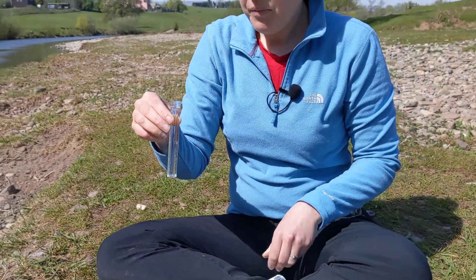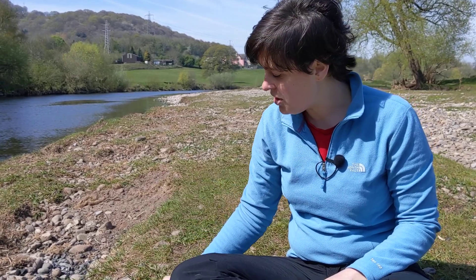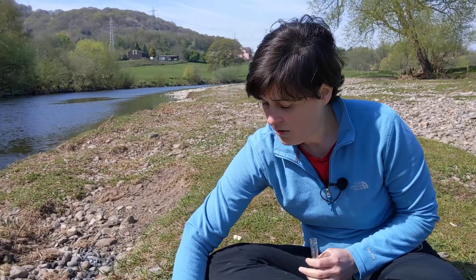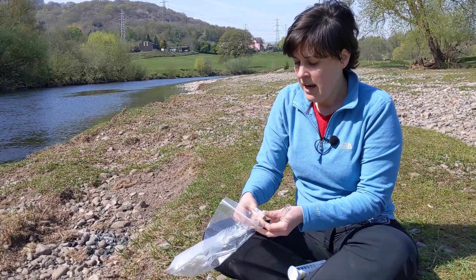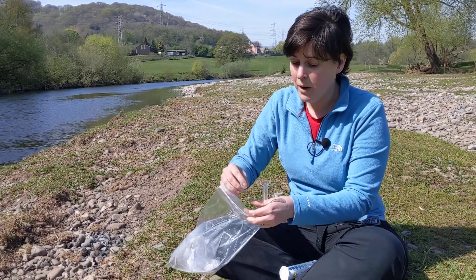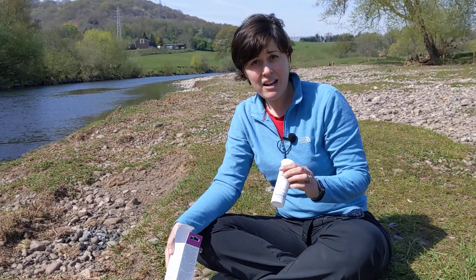When you're finished you can discard your sample — there's only a tiny amount of reagent in there so it's safe to discard onto the ground. Then dispose of your test strip into a waste bag which you can take home and put in your household waste, cap back on, and then take it to your next site.